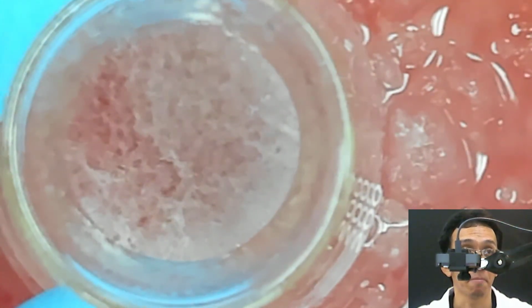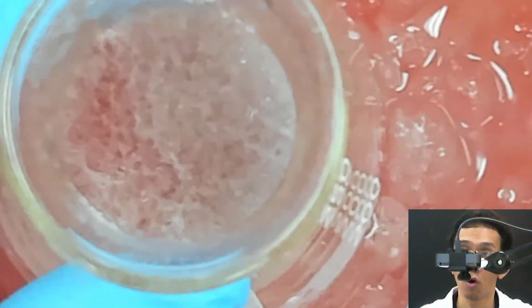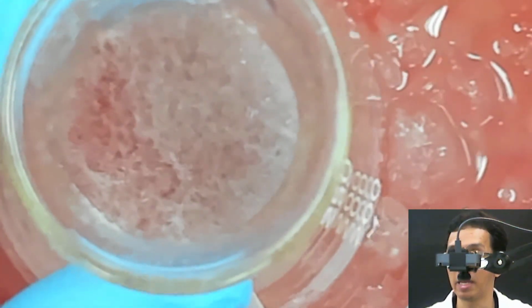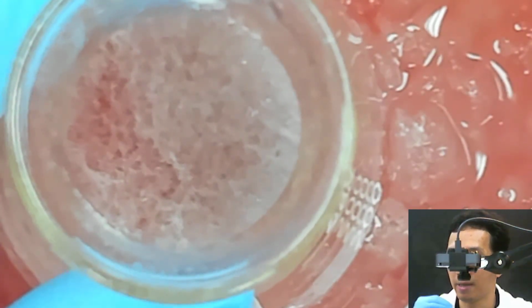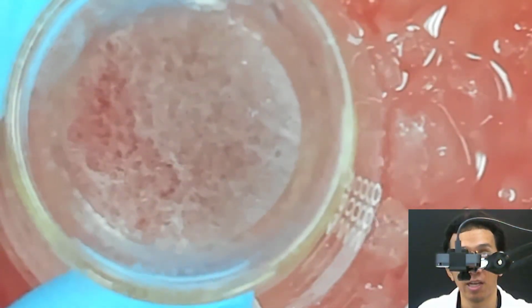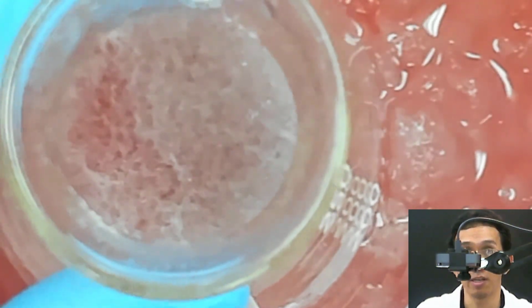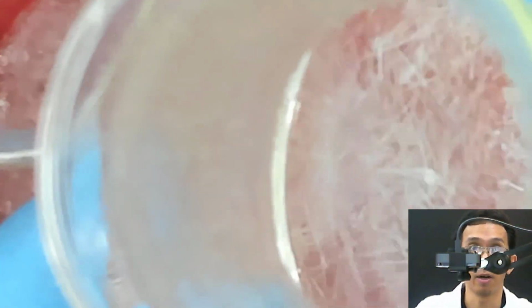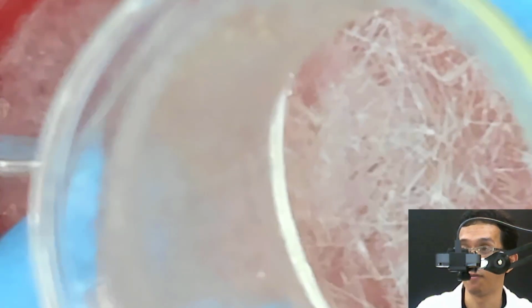The reason is that the salicylic acid in the hot solution doesn't have enough time to rearrange itself into a nice structure like the needle structure we saw before. That nice structure was because the acid had time to rearrange itself.